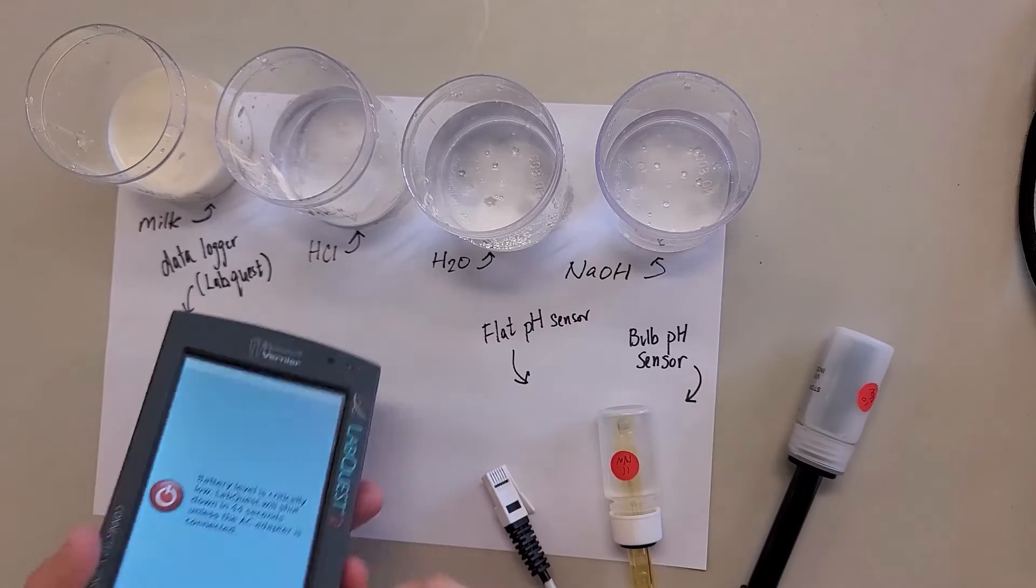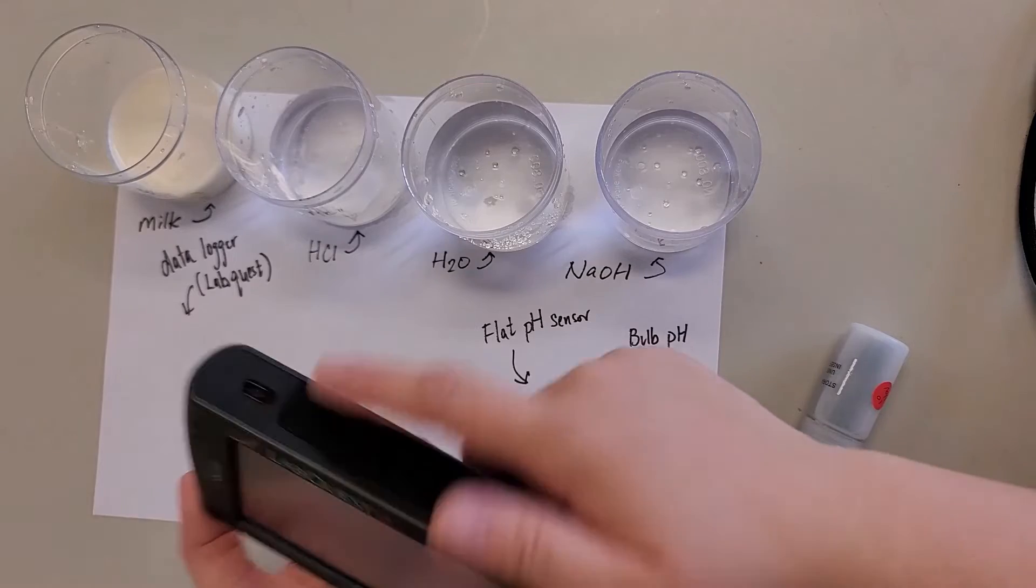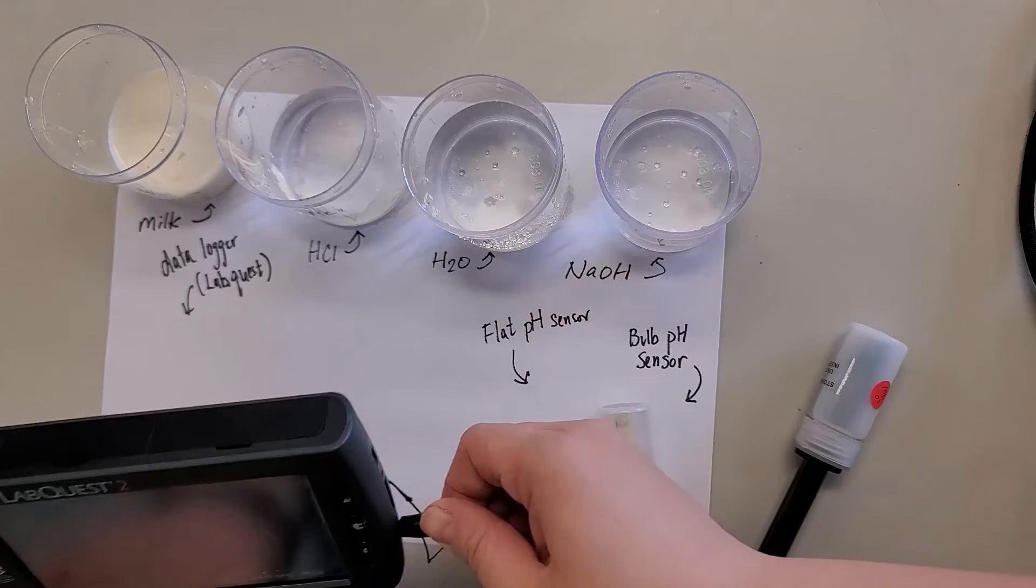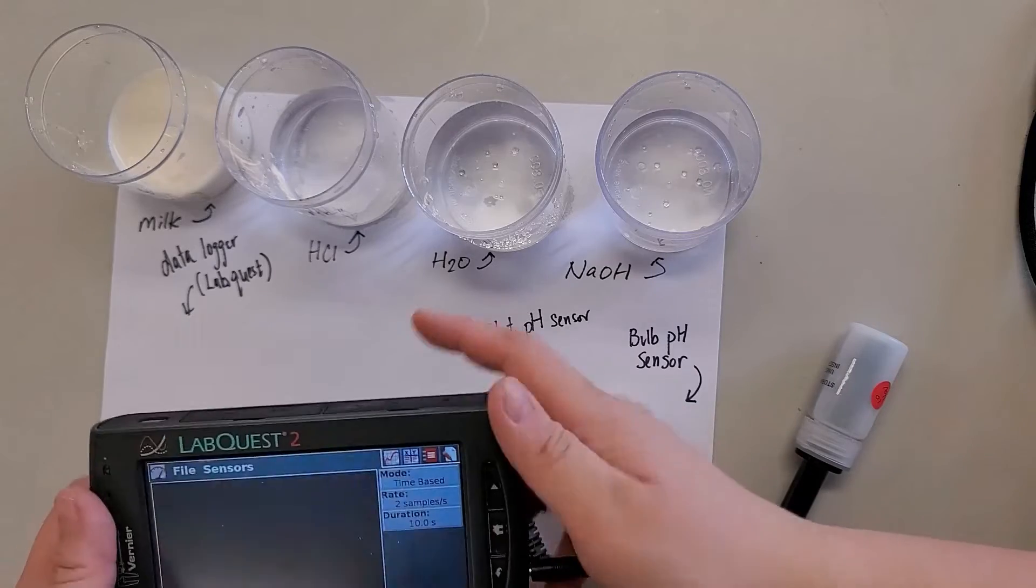Click the little save button. Aha. Switch it on. You can find the on button here. So usually when it starts, it should start right away. It's the sensor mode.